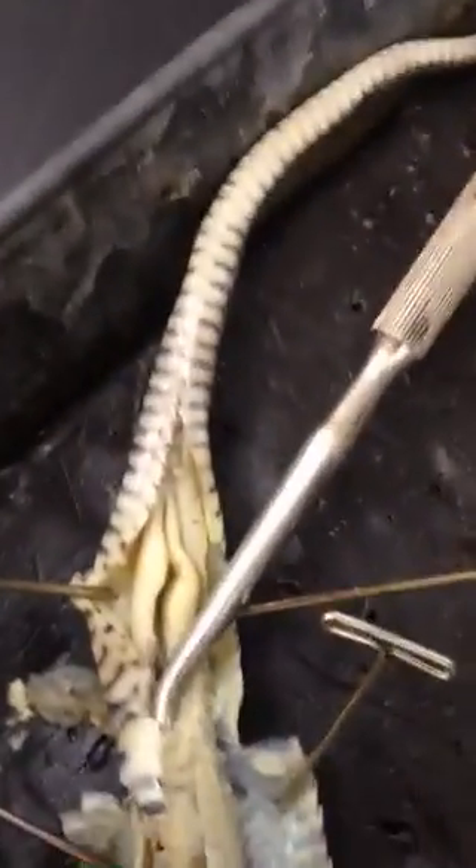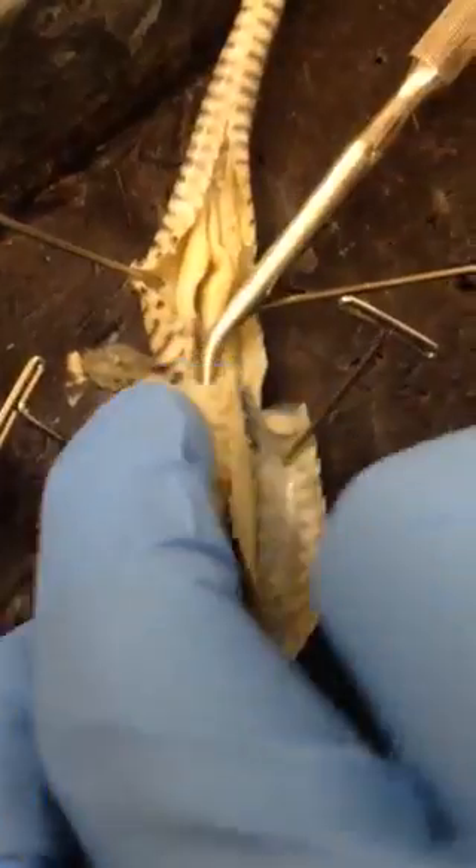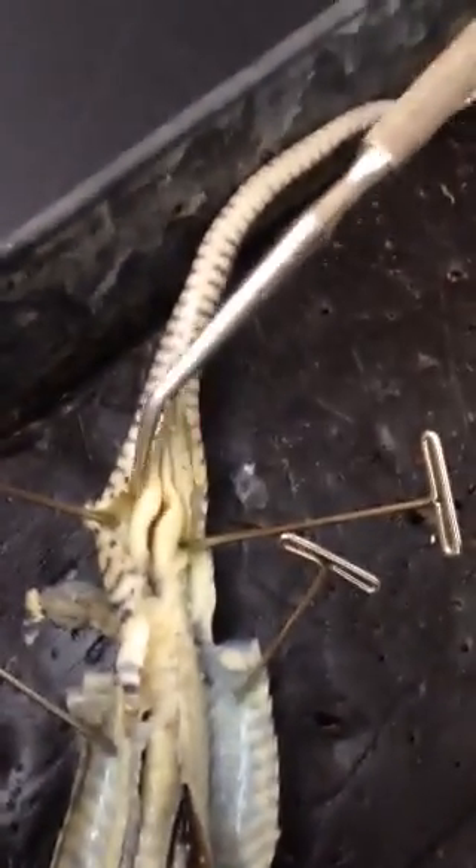As we go back, you can see that we are inside of a tube right here. This tube that we are inside of is the cloaca, and the exit to it is the anus. These two things right here are the hemipenes.